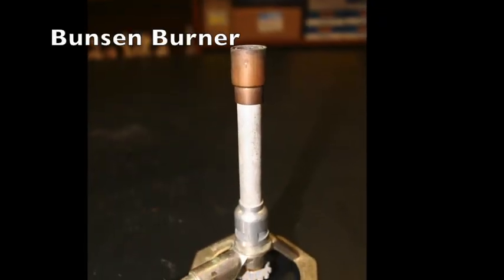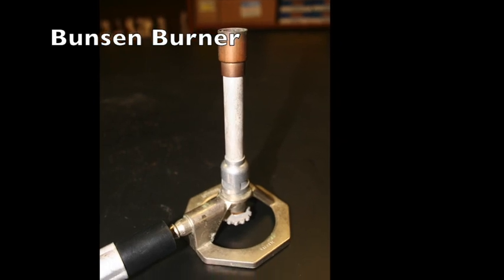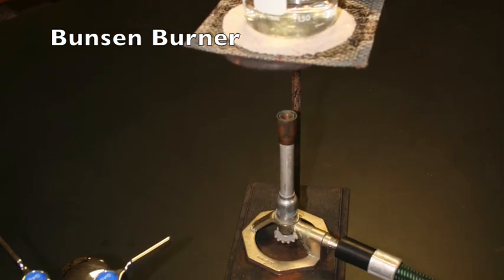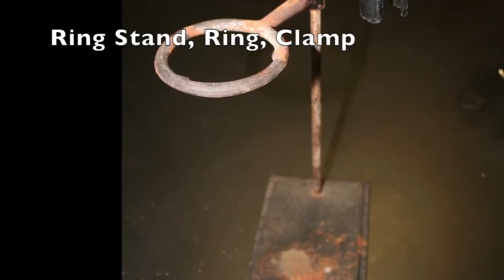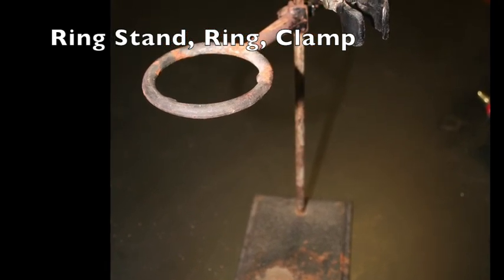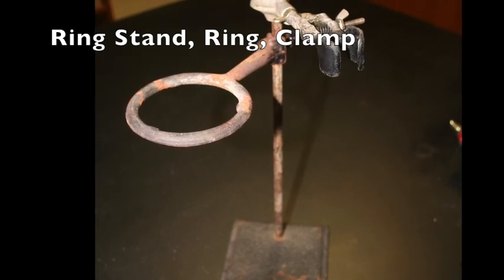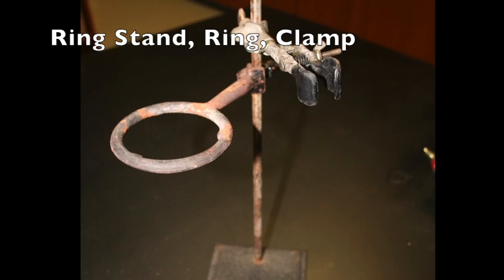The Bunsen burner produces a flame for heating or burning substances. The hose connects the burner to the gas outlet jet. Take care to tie back hair and to not reach over a flame. The ring stand provides a stable platform to which equipment may be attached. A ring is secured to the metal pole and a wire gauze square can be placed on top of the ring so that a beaker of a substance may be heated by a Bunsen burner below.